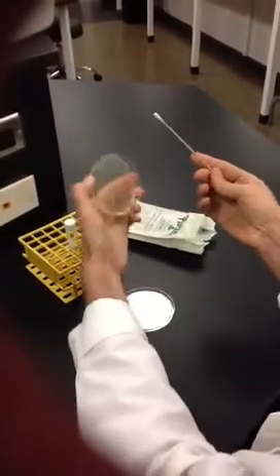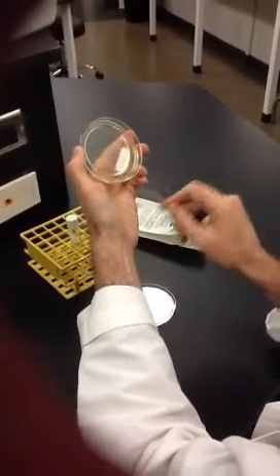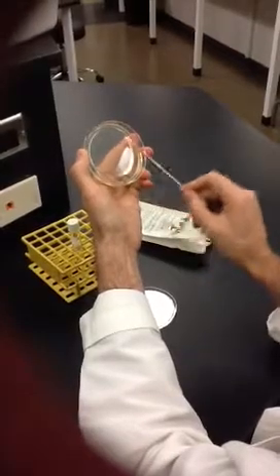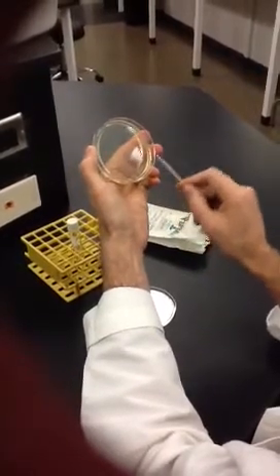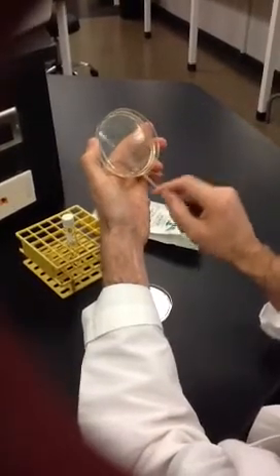To make the lawn, you begin by dragging the swab across the center and painting with your culture, going back and forth thoroughly to cover the section, gently spinning the swab to get all sides.